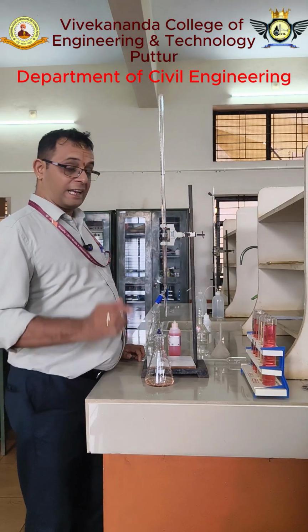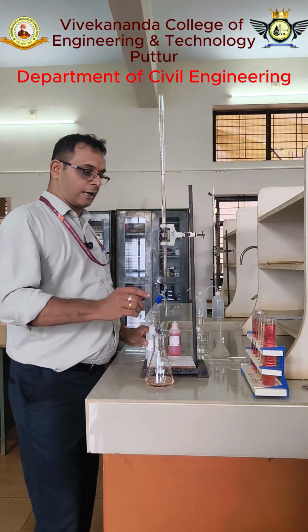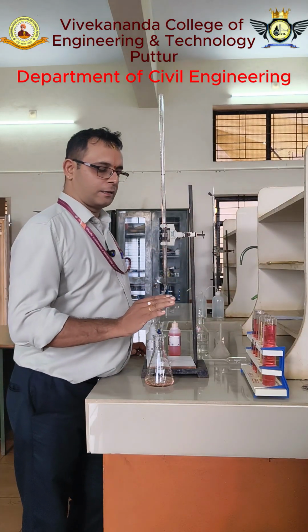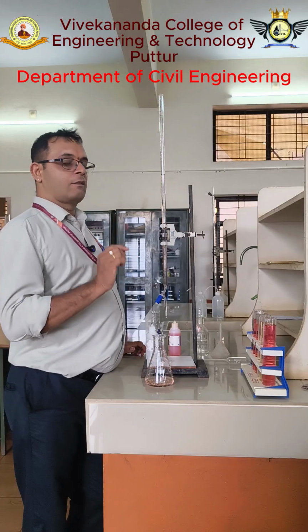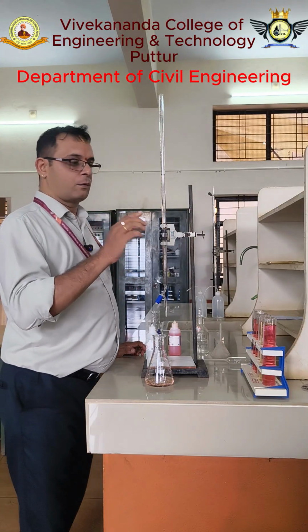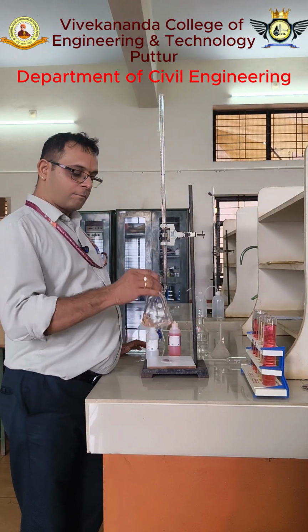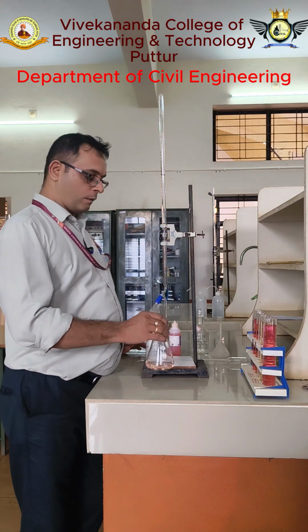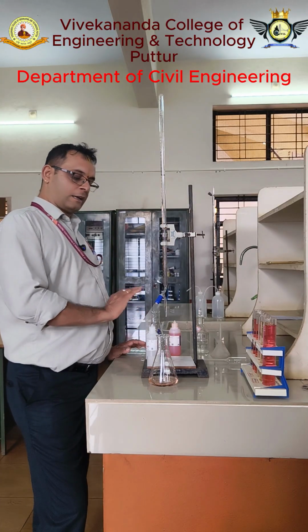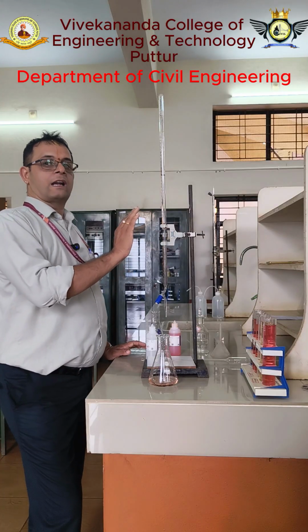See, in this experiment, at the beginning when I have added phenolphthalein indicator, if the color does not turn pink and the sample remains colorless, then we have to write down that the phenolphthalein alkalinity is 0. No need to titrate it. Immediately I have to add methyl orange. When I add methyl orange, you will get a yellowish color, then it will come to pink color, right? So this is the experiment for alkalinity.